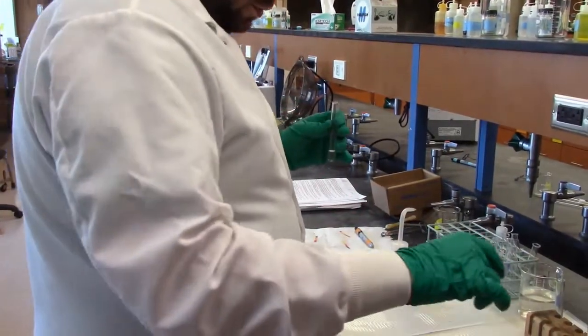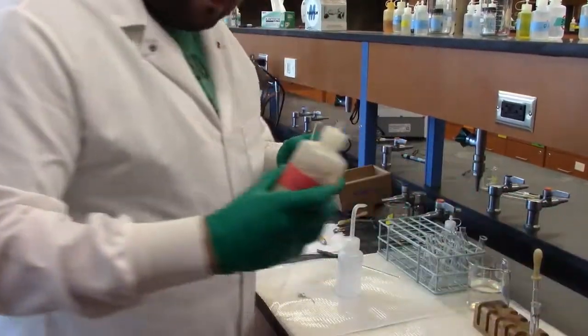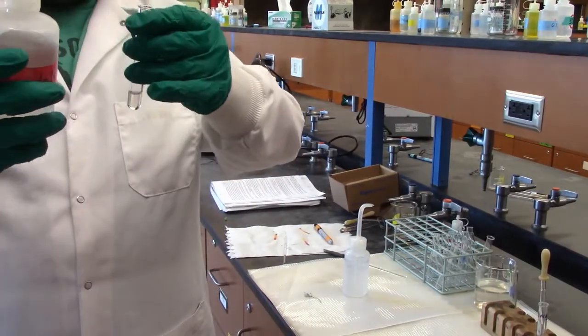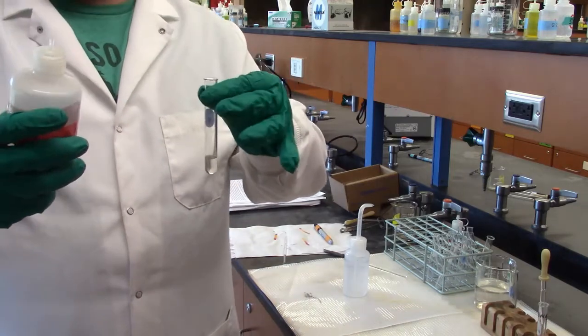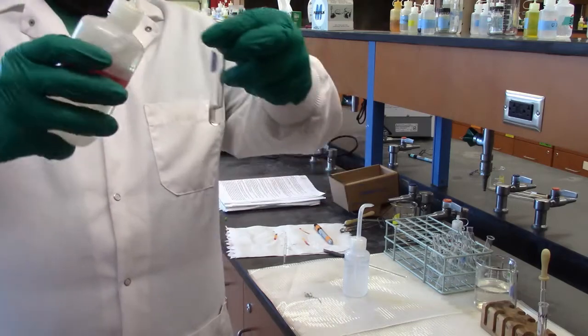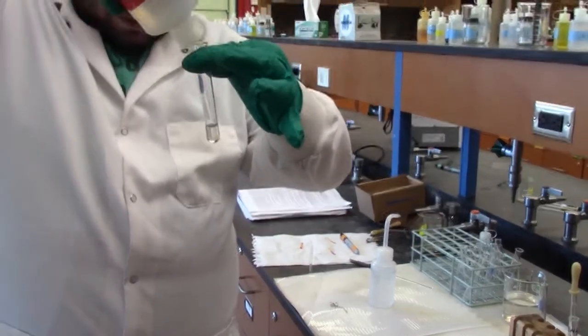So, here it is. Make sure that's tight. Oh, I can smell that. If any of you have ever smelled ammonia cleaner, it's also unpleasant. This lab is very colorful and very fun, but oh, it's smelly. So yeah, let's add some drops to that and see what happens, shall we?